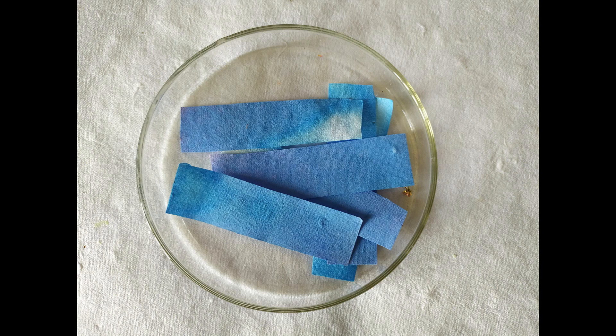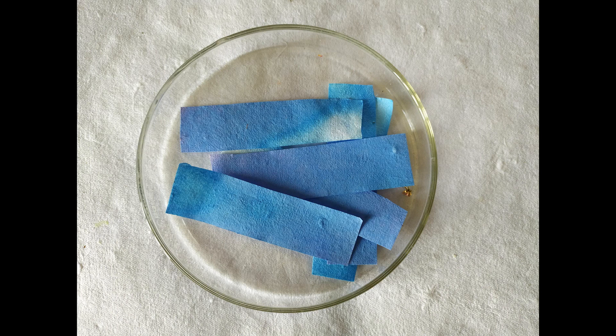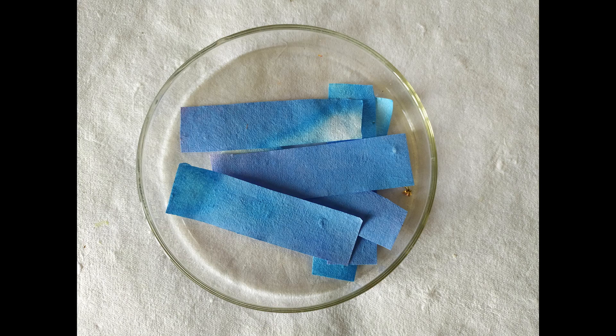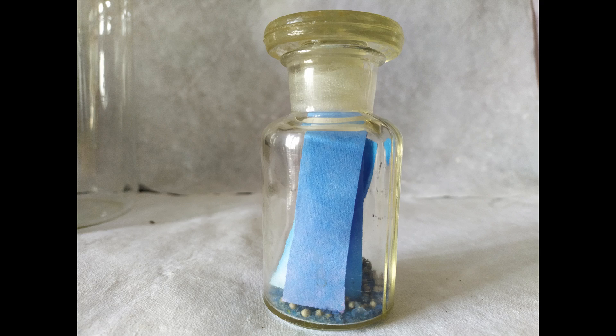Once they're dry, cobalt chloride papers turn blue in color. The blue color immediately turns pink when in contact with water. You may store the dry paper strips in an airtight bottle for future use.